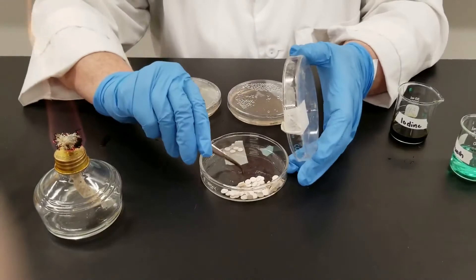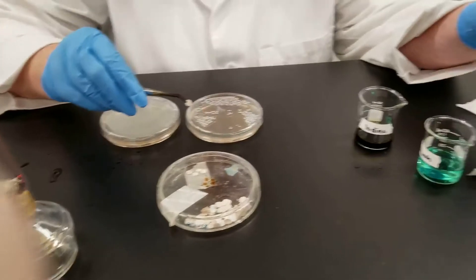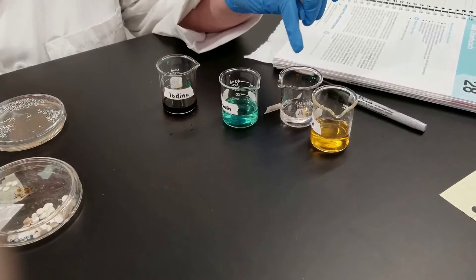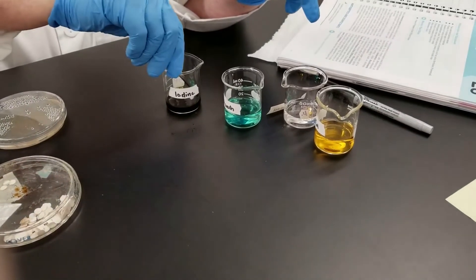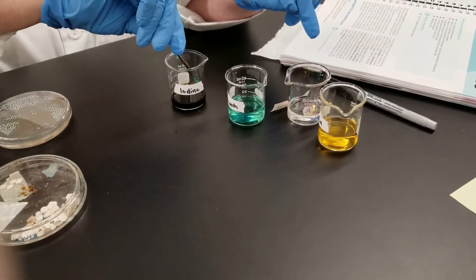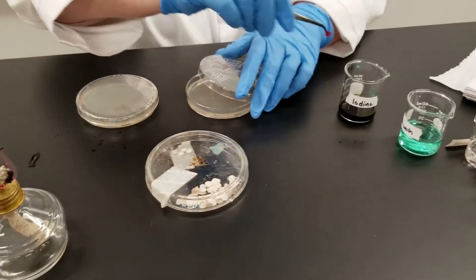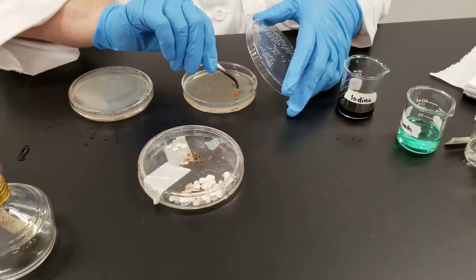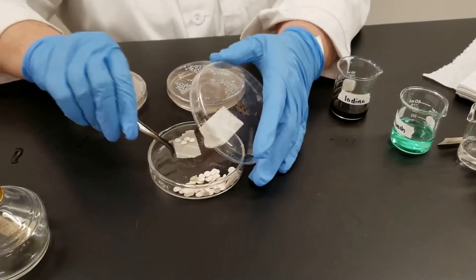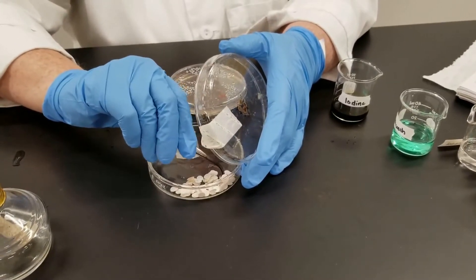What I'm going to do now is take these little paper discs and dip them into the different substances. We have four different substances to test: iodine, mouthwash, witch hazel, and pine sol. I'll just dip it into the solution, tap against the side to get the excess off, and similar to what you see with antibiotic discs, just lay it on the surface.